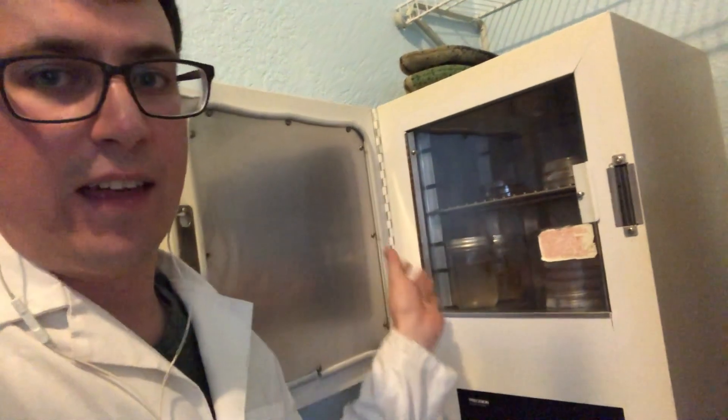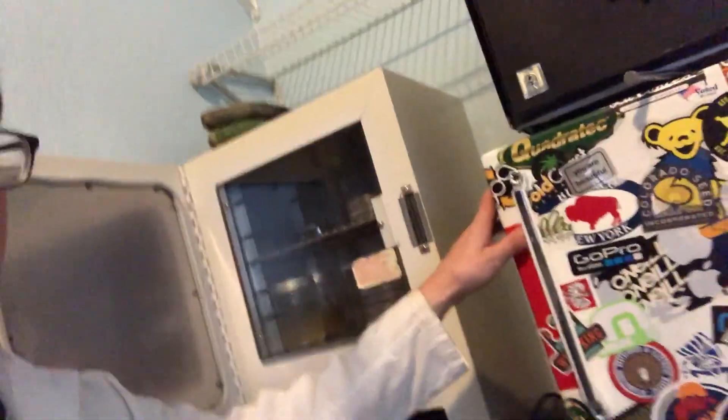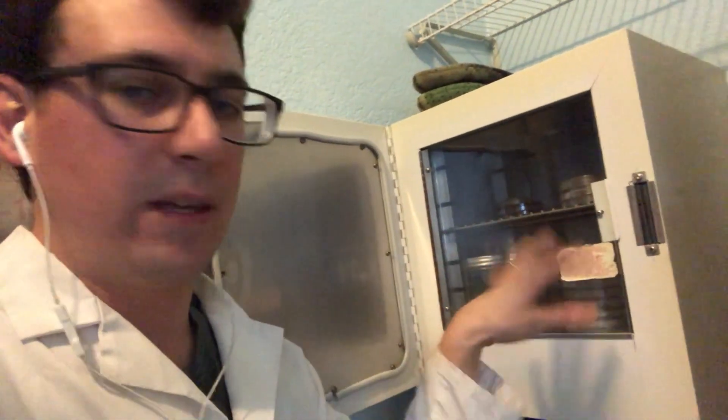And they'll probably be stuck holding the rest of my production for about four or five days while those isolates grow out. And then I'll transfer those over to the fridge. I got my mini fridge here. And then I also have a larger fridge where I keep all my reagents and my slant cultures and any backup plates in case something happens with these.